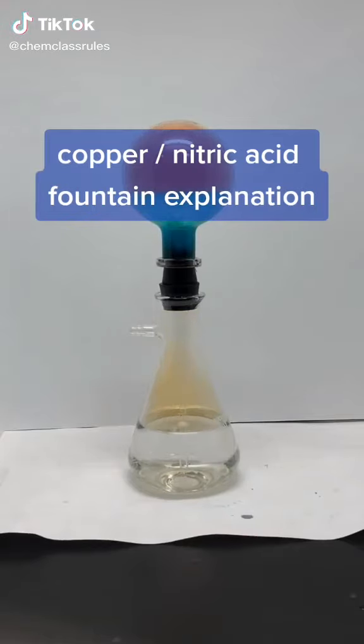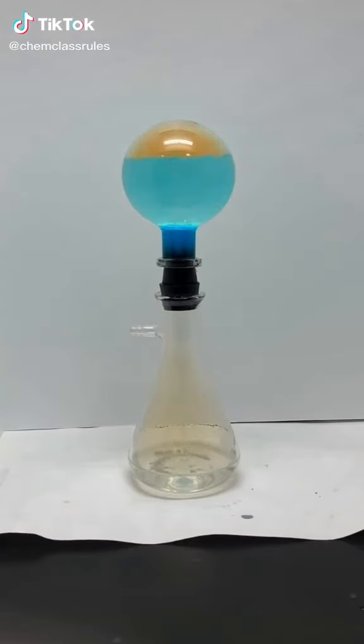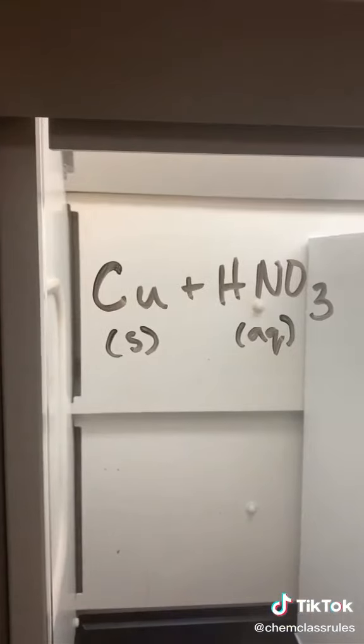Hey everybody, Chem Class Rules here, and today we'll be explaining the nitric acid copper fountain. Don't do this one at home.